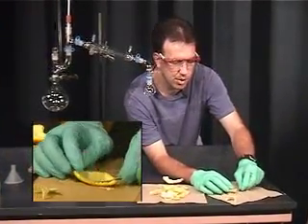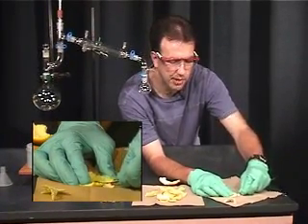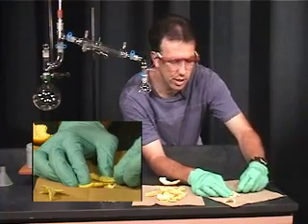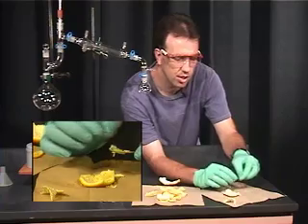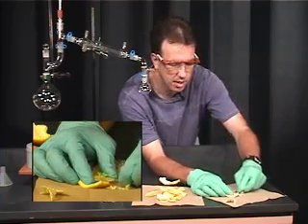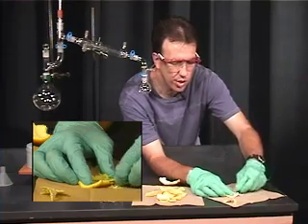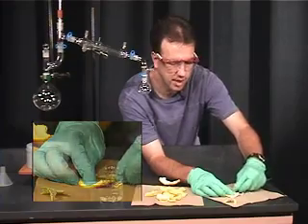As you get closer you'll simply have to scrape very lightly back and forth, where you can see the bumps of the orange become visible on the inside of the peel. Once you have gotten to that point, then you know you have gone far enough.